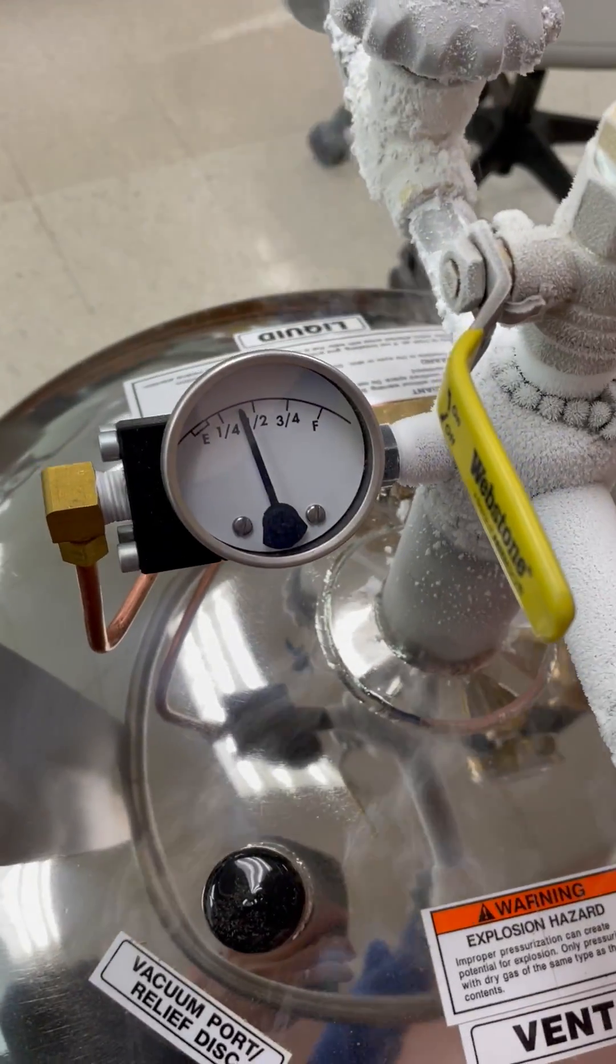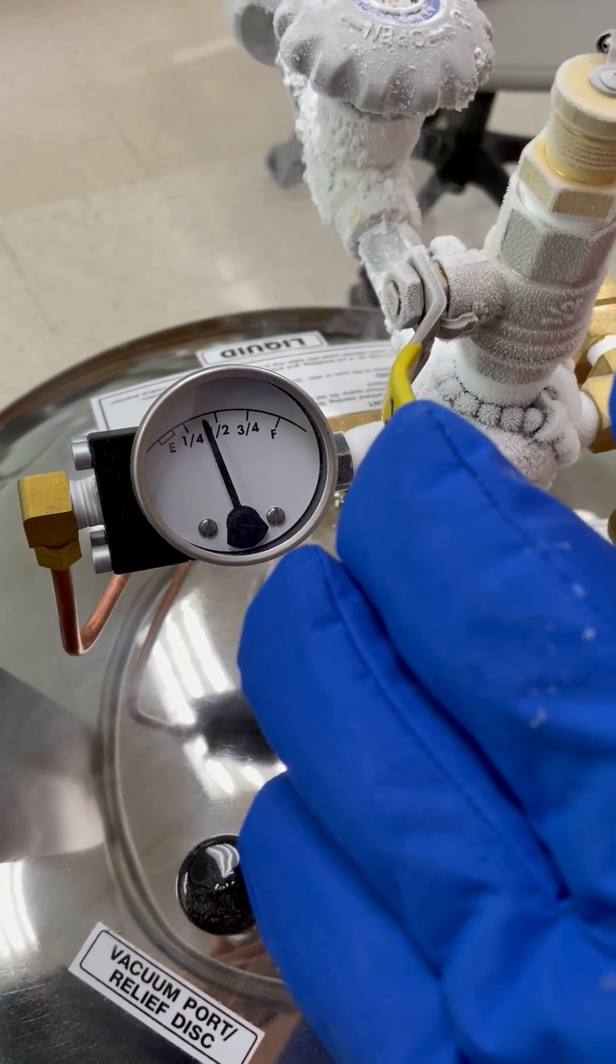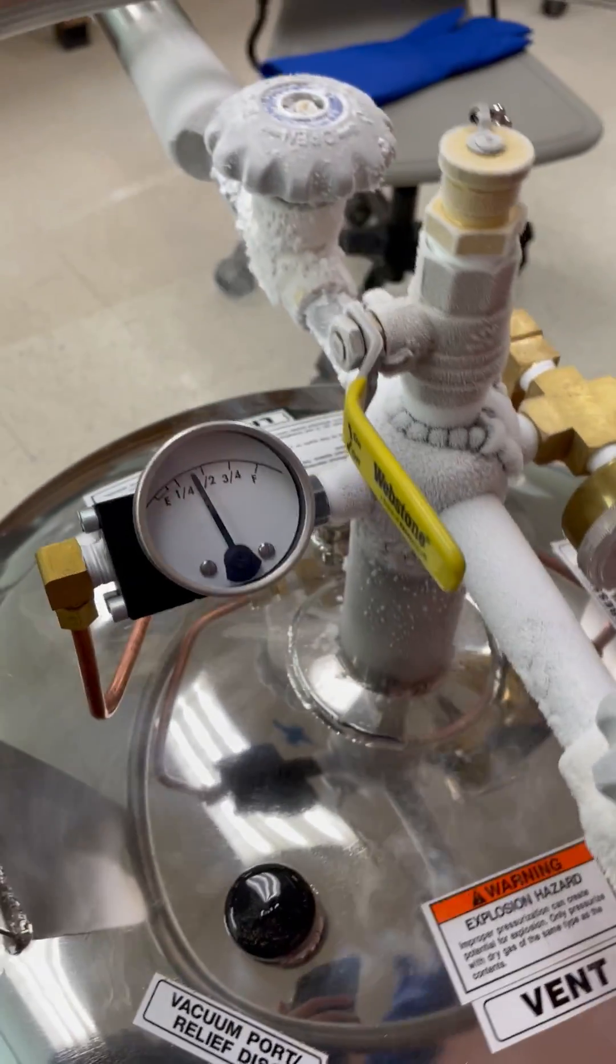Now you see that it's cooling, and it took about 10 minutes to reach here, and we need to wait.